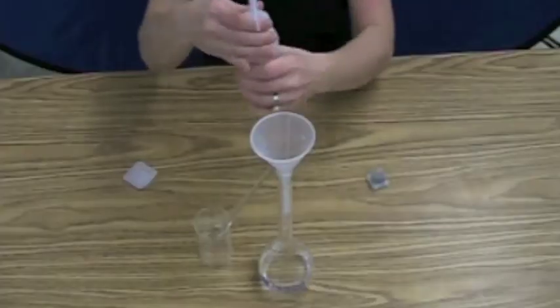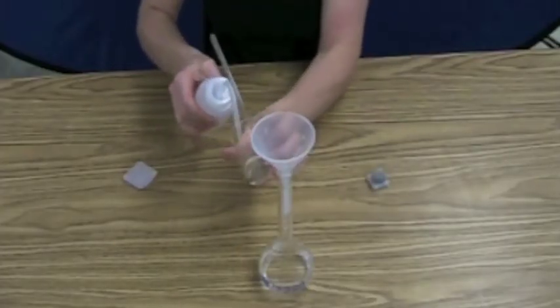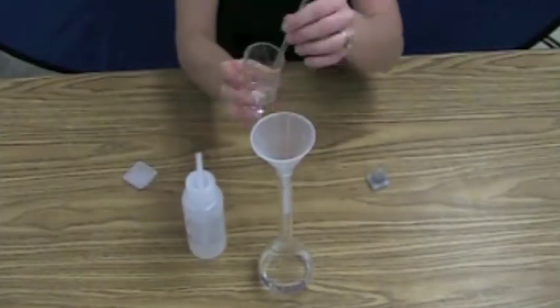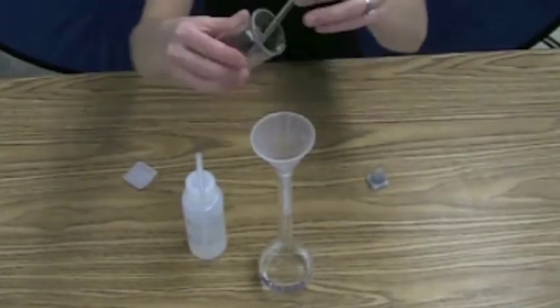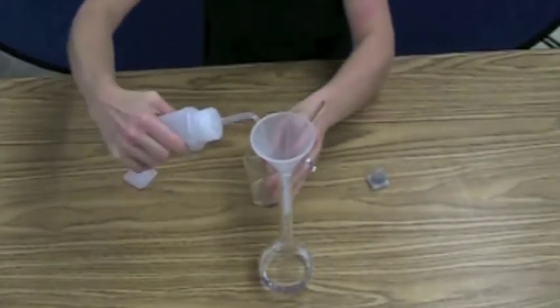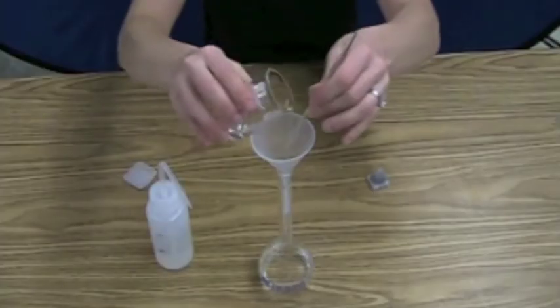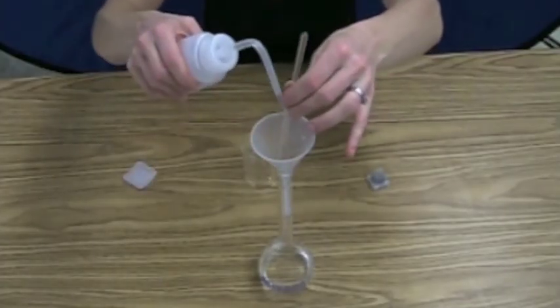but then to make sure I don't lose any solute in the drips left behind, I'm going to rinse out the beaker a couple of times with my solvent, and pour that rinse into the volumetric flask. And usually you're supposed to do this about two or three times. And I've sped it up because it's not very exciting to watch. And then you also rinse off the stir rod.